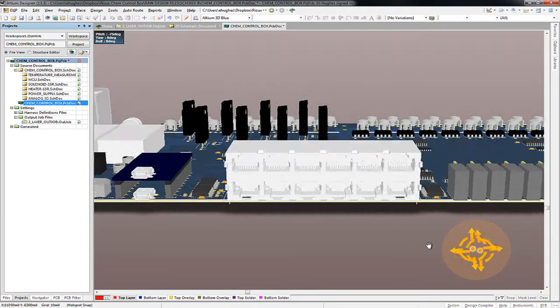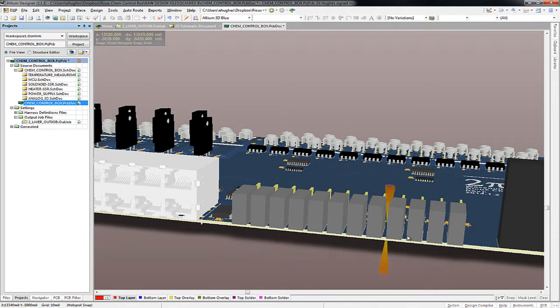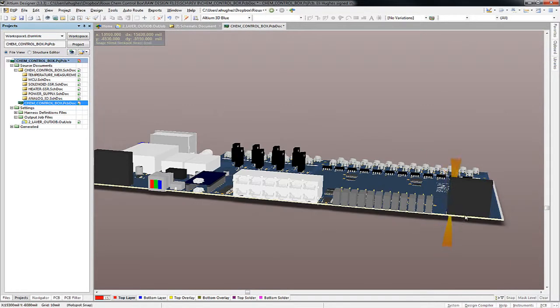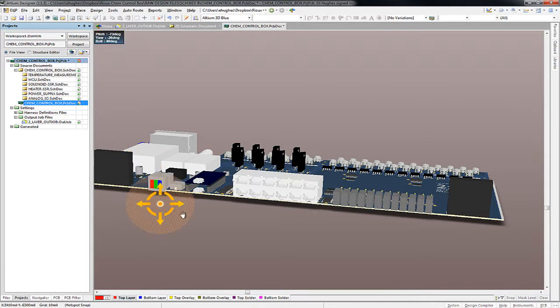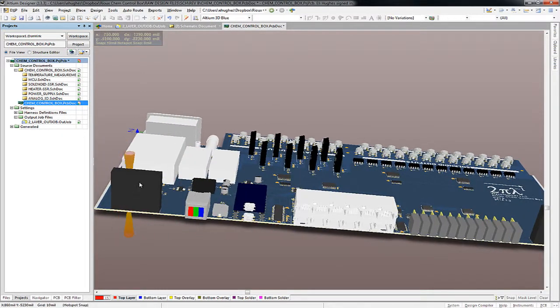There are nice functions. There are 12 thermocouple inputs for the Omega thermocouple mini connectors. These two black boxes on the front are actually for 2 fans. The idea of the fans, once they're turned on, is that the front panel is going to have an opening for these fans to suck air in.